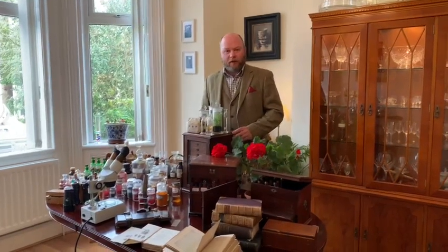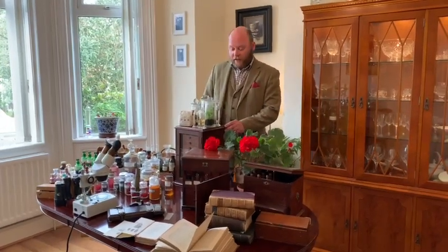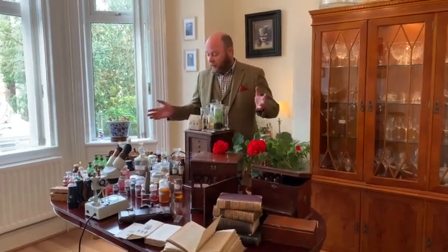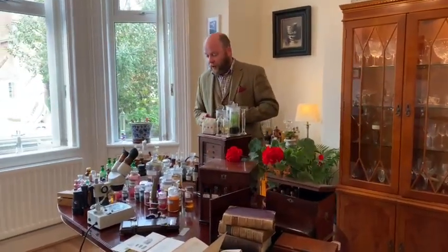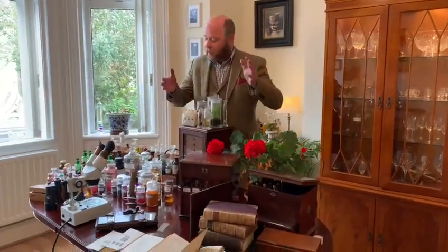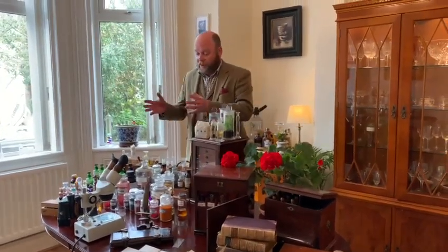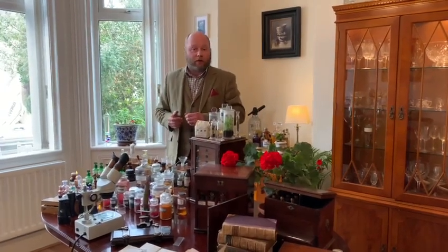Welcome back to Adrian's Chemistry Laboratory. As you can see, we're not in my laboratory today — we're actually in my dining room. A very nice chap texted me called Ronald Credo and he requested whether he could see some of my microscopy equipment. I thought I'd take this opportunity to show off some of the collection I've had for a number of years. We'll start off by showing you some of the antique equipment and then move later on in the second part of the video to show you some of the stains and dyes that would be used, and maybe how you could start up your own little microscope laboratory.